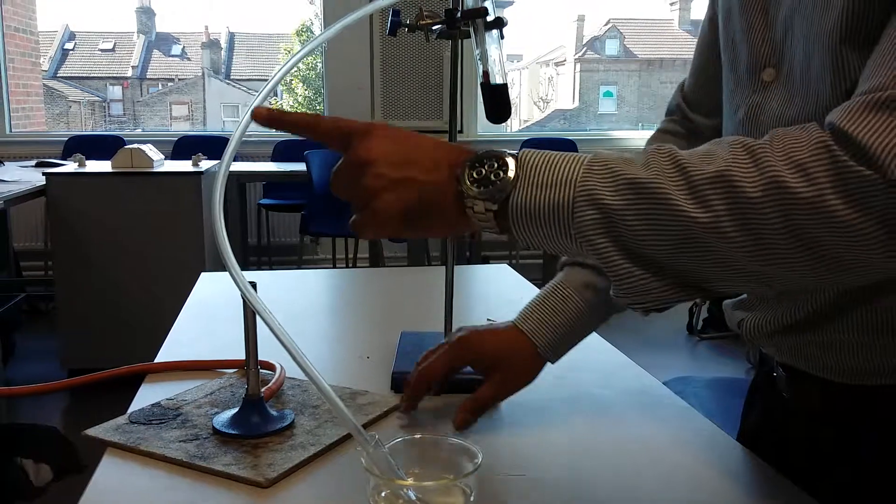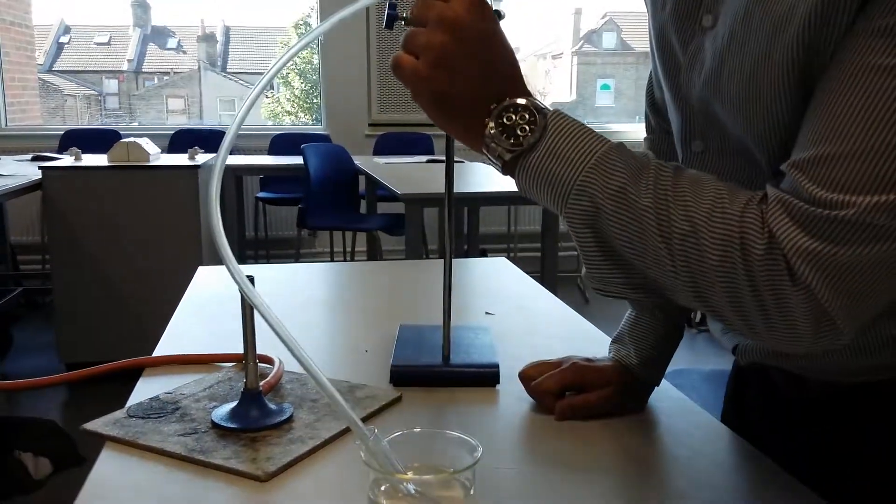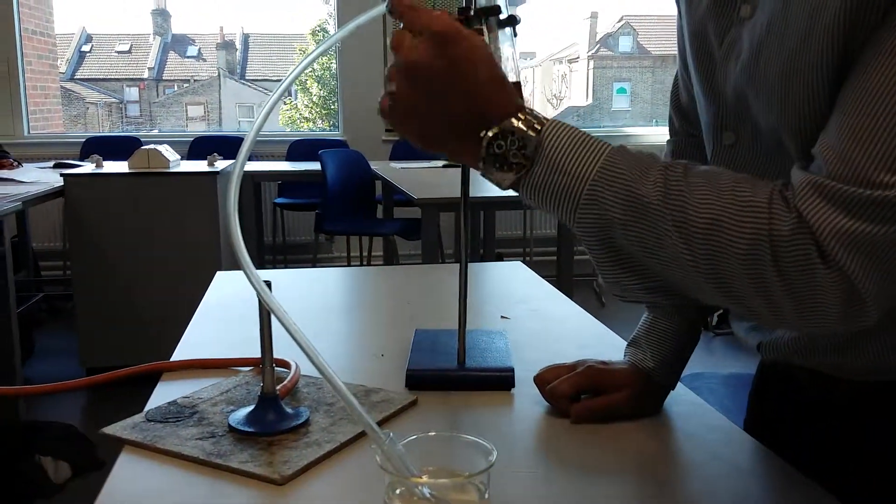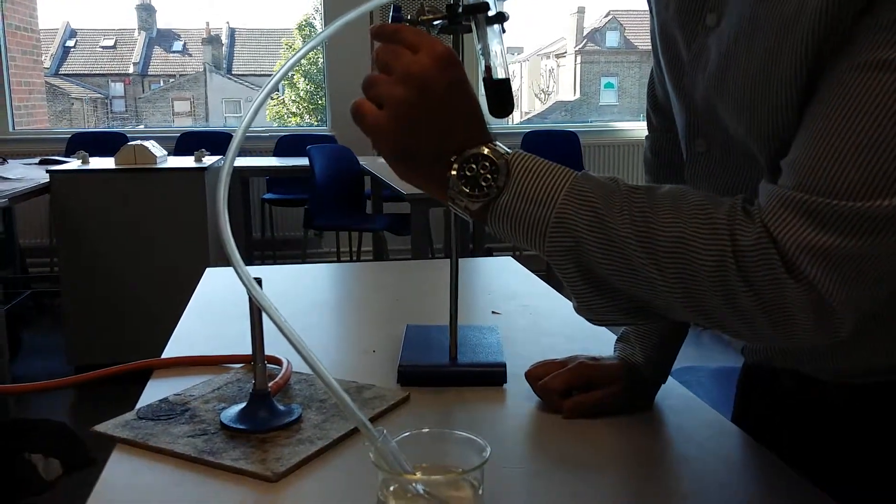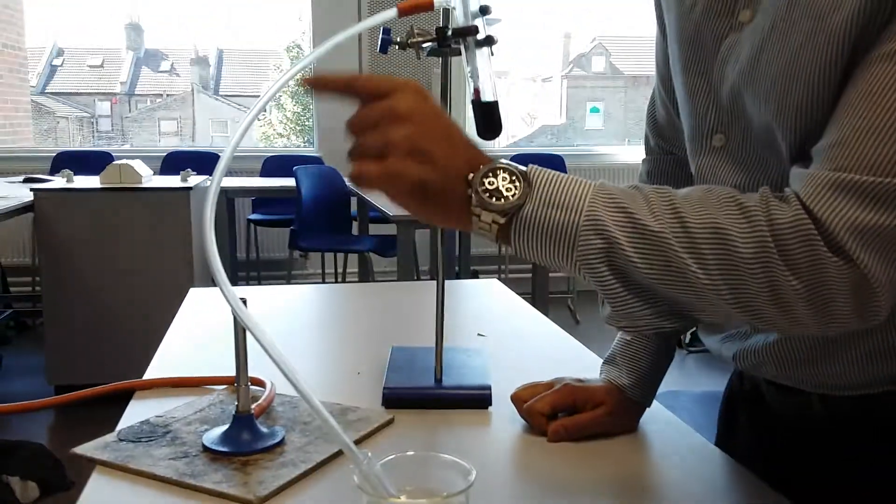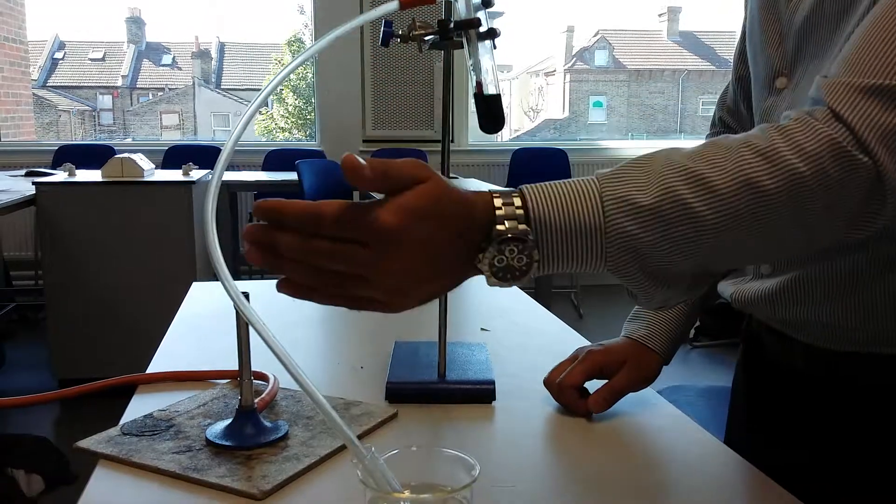It was in the fridge earlier and it's actually very cold. So you can see some of that steam that's coming out, the boiled liquid that's coming out and it's going through the pipe over here. What's going to happen to it as it goes through this?